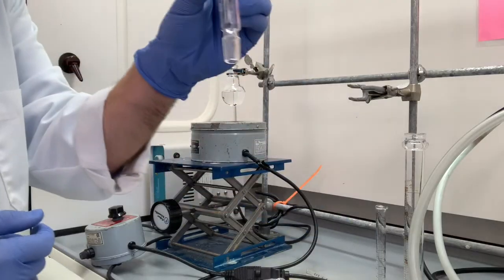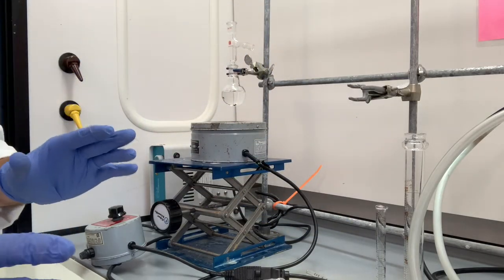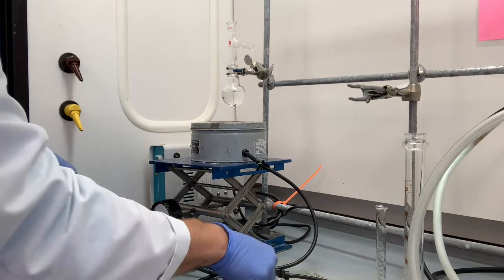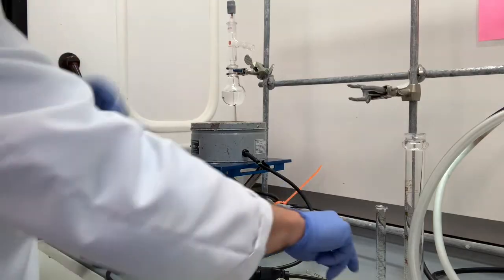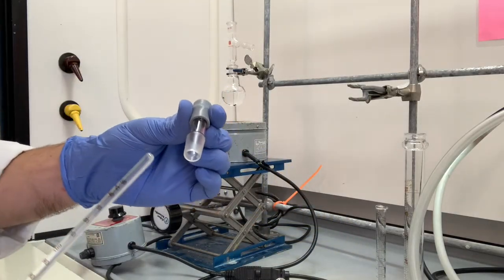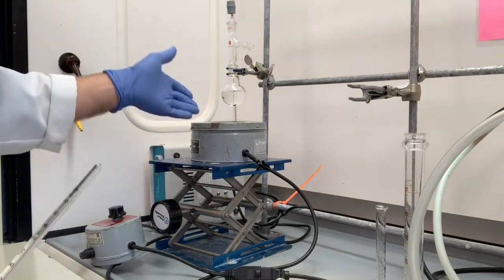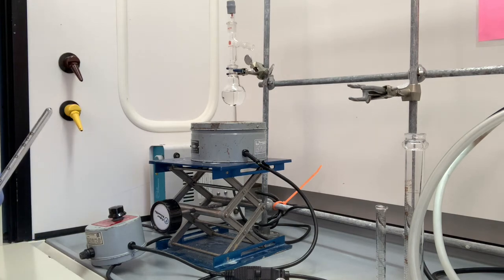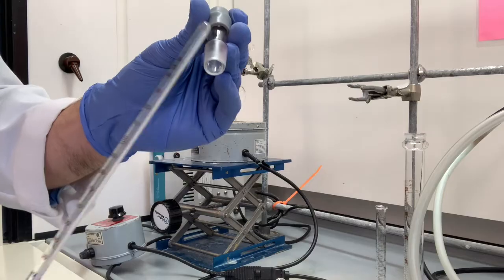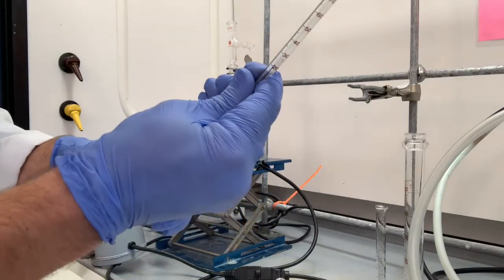The first thing, the three-way adapter goes right here. By the way, this is the simple distillation, not the fractional yet. And then we're going to put in the thermometer adapter. So the thermometer adapter is this cylindrical piece, has this ground joint. These glassware pieces all sort of fit together like Lego because they have these ground glass junctions, 14/20 junctions. We're going to slide the thermometer inside here.